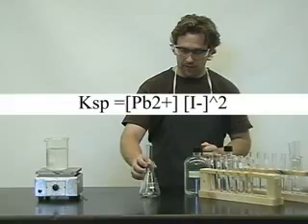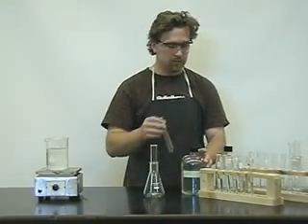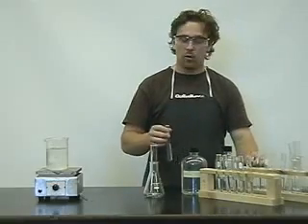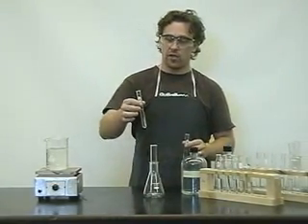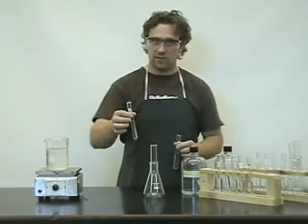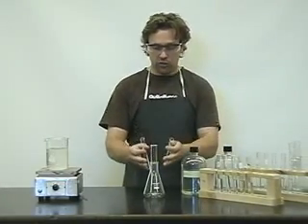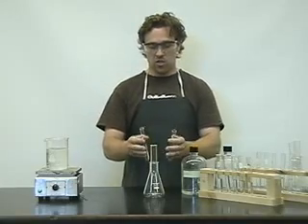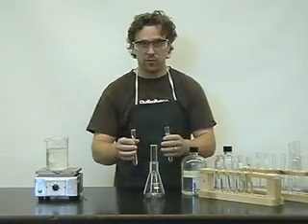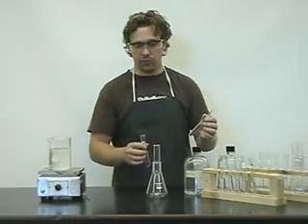We'll begin by taking potassium iodide and lead nitrate. The net equation focuses on the I⁻ and the Pb²⁺ ions. When we mix the two solutions, we will determine if a solid — remember, we call it a precipitate — is formed or not. We will do that for six test tubes, determining if a precipitate is formed in each one.